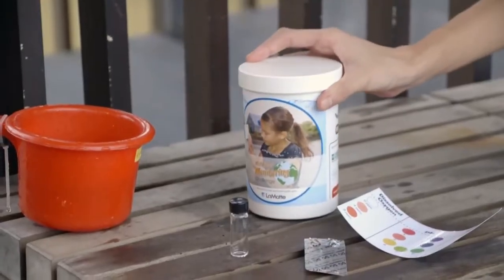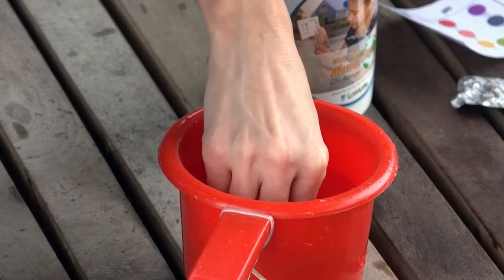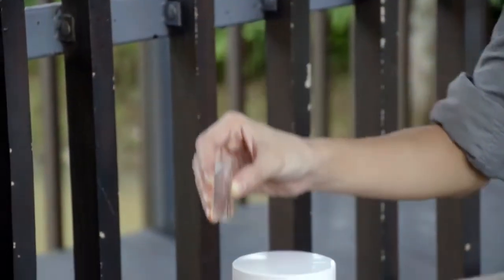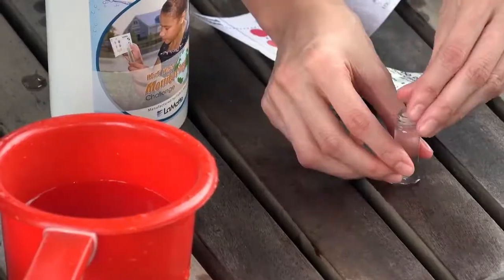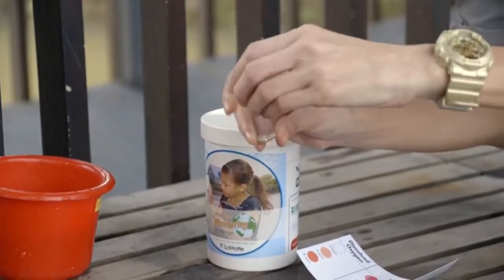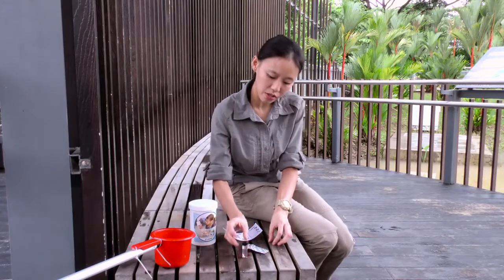We will now measure dissolved oxygen using the PUB kit. First, fill the small vial provided in the kit with water. Make sure that the vial is fully filled and that there are no bubbles. Then, drop 2 dissolved oxygen tablets into the vial. After you cap the vial, dissolve the tablets by shaking it from side to side. Once the tablets are fully dissolved, allow for 5 minutes for the colour to fully develop.